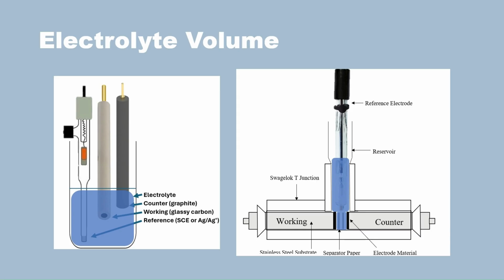So for your electrolyte, you want to make sure your system won't be electrolyte limited, as in it could be storing more charge, but it can't because there's not enough electrolyte available to store the charge. To fix that, all you have to do is just make sure you always have an excess amount of electrolyte present. So here we have absolutely plenty. Same for the Swagelok. If this needs more, there's plenty of room for extra electrolyte to move down. So that way, if you're characterizing a working material or electrolyte, you can get a definitive result that represents the actual capability of the system, whether that be your material or electrolyte.